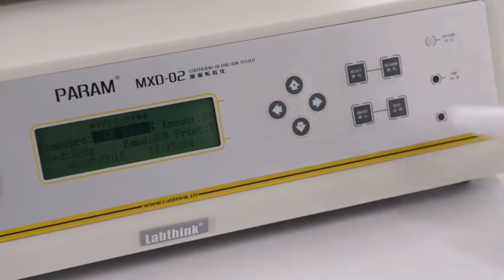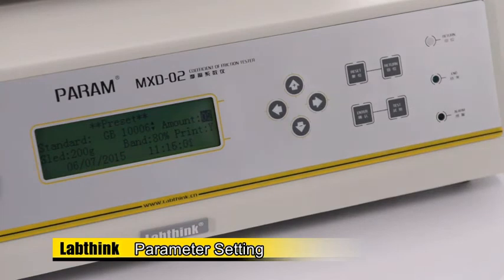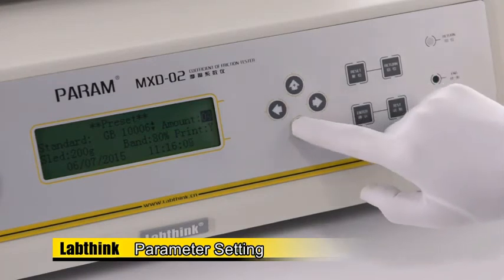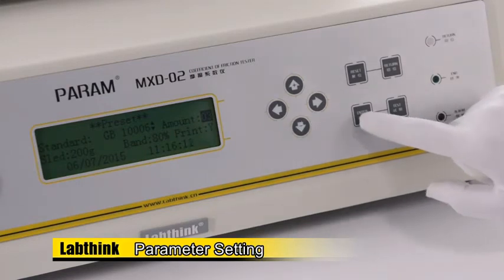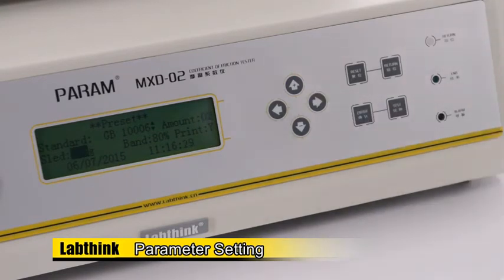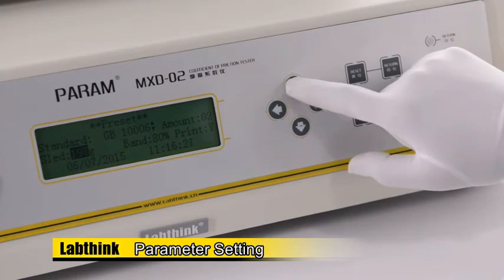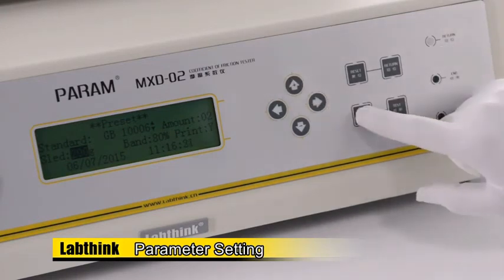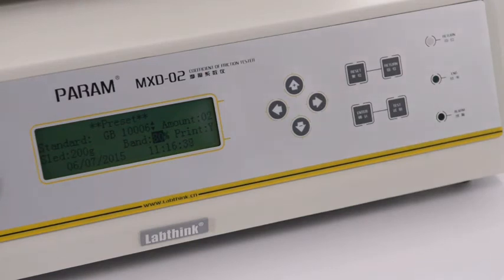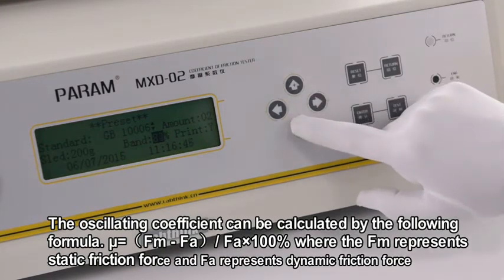Press Return to return to the preset interface. Set amount as required and press Enter to save the setting. Set Sled as 200g and press Enter to save the setting. Set band as 80% and press Enter to save the setting. The oscillating coefficient band is recommended to be 80%; if it is too low, the system may prompt that the test has failed.